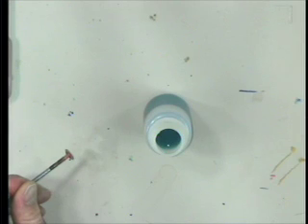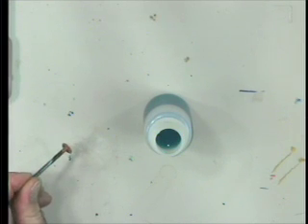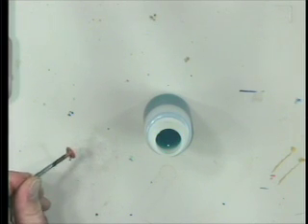I think you can see there's lots of copper metal on the head of that nail. And if you were to analyze that, you'd find that this is, in fact, copper metal — copper atoms lined up in the appropriate crystallographic orientation. You could prove that that's copper metal, that copper-colored stuff on the nail.